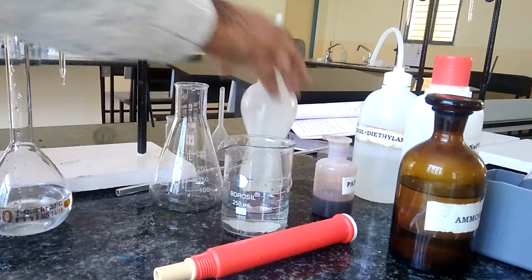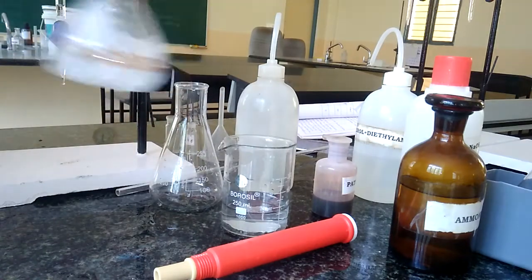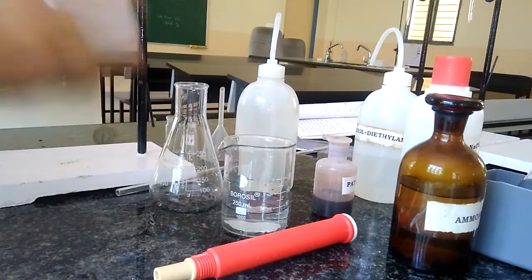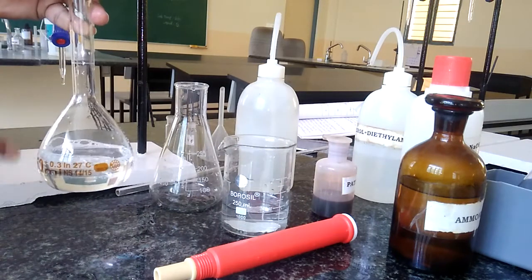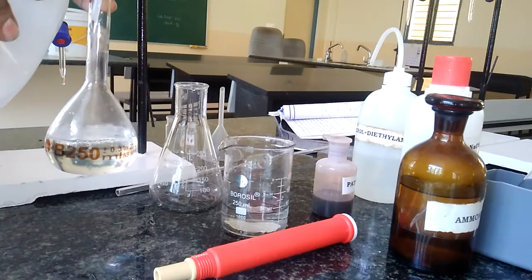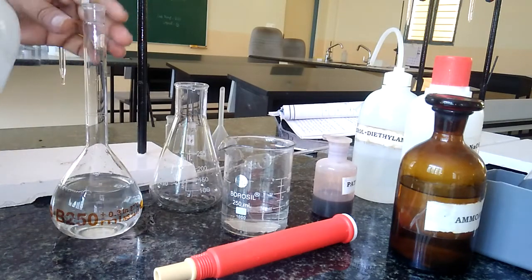After this, let us continuously mix this solution by putting the stopper. We have to mix the solution until the EDTA salt completely dissolves. Carefully we have to mix the solution. After a few minutes, we check whether the salt is dissolved or not. All the EDTA salt gets completely dissolved in the presence of ammonia and water. Now let us dilute this solution up to the 250 ml mark using distilled water carefully, or we can take the help of a dropper in which water is added drop by drop so that we can accurately prepare 250 ml. Otherwise, if the mark exceeds 250 ml, the molarity may vary.